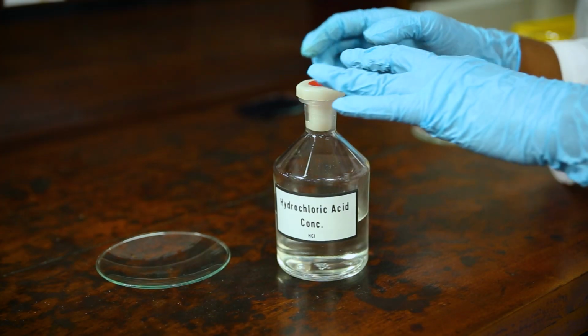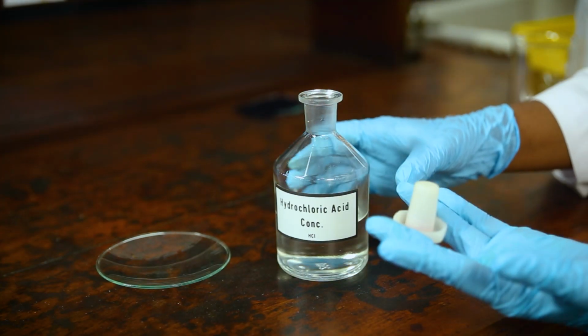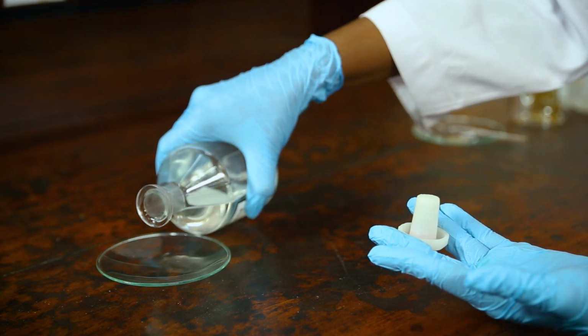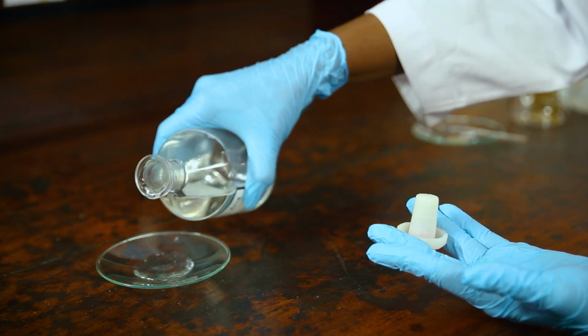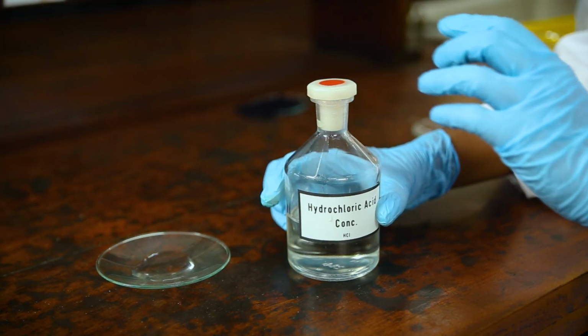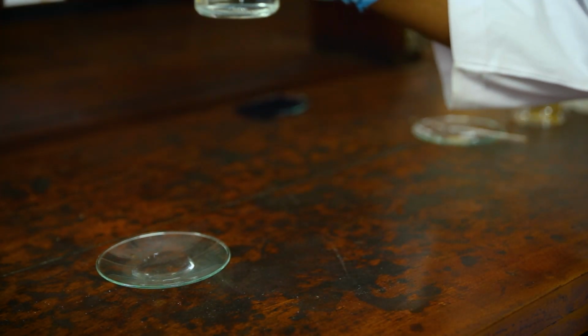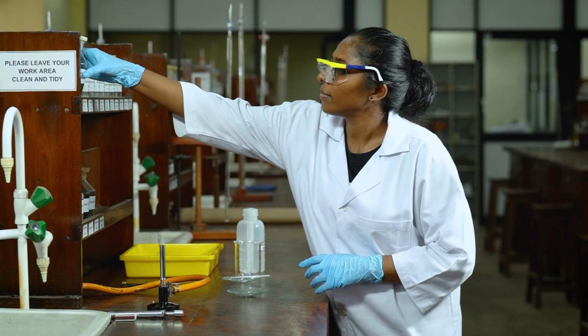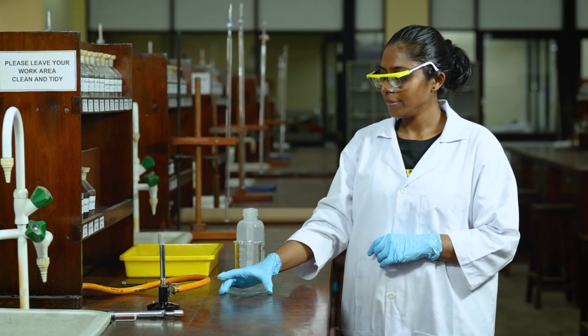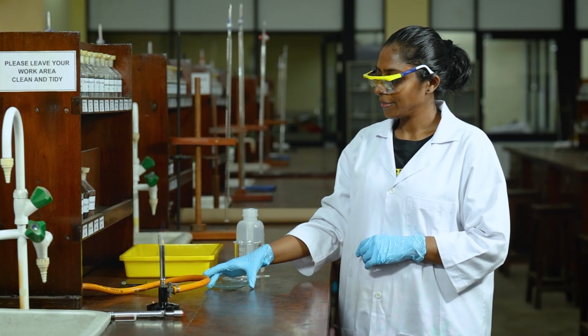After taking the reagent bottle from the shelf, first we loosen the cap. Then we take the bottle cap off using our middle finger and the ring finger, and keep the cap neck upright between fingers. Then gently pour a sufficient volume into a watch glass. After taking the hydrochloric acid, close the cap tightly and return the reagent bottle to the shelf. The third step is to perform the flame test using a platinum wire loop.